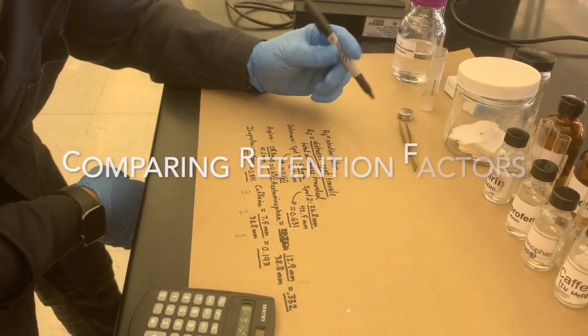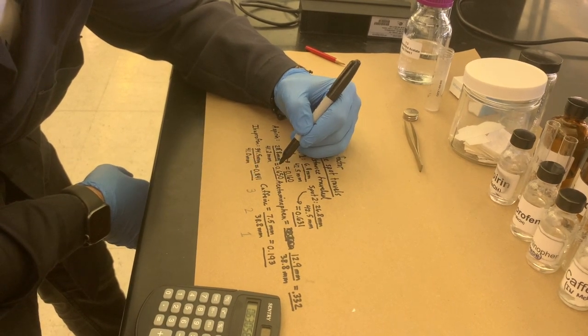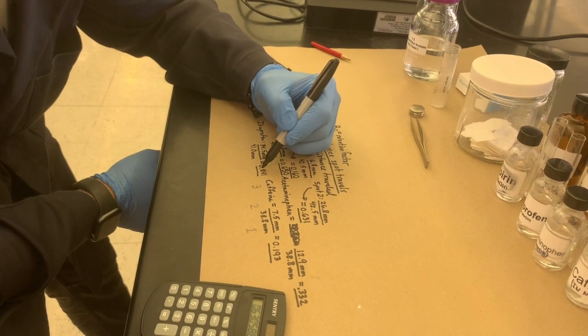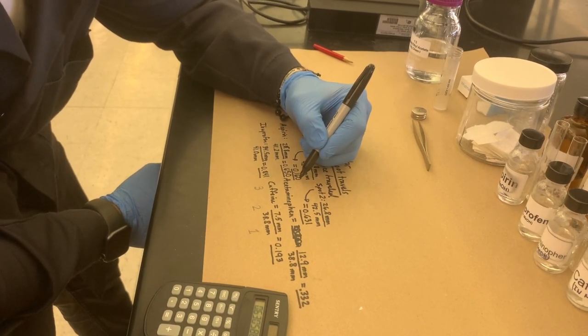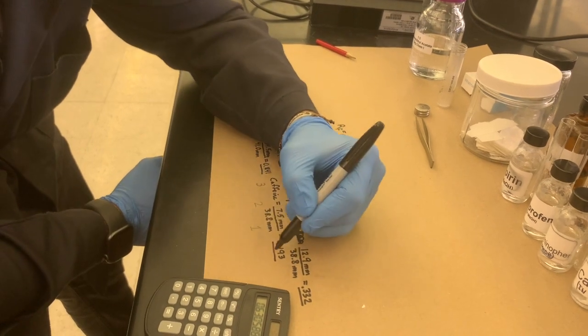So we look around, and we have our first unknown spot, and we look at these 4 values of the knowns. You have 0.650, 0.841, 0.332, and 0.193. This one is drastically closer to one in particular, and that one is going to be the caffeine.